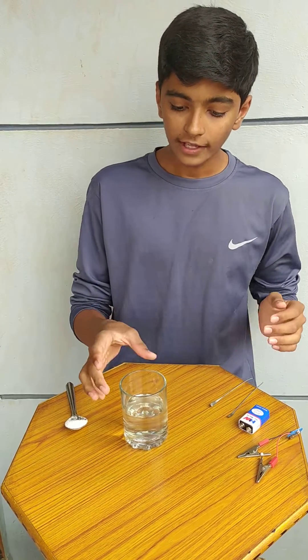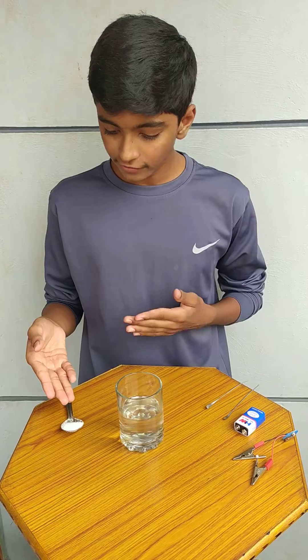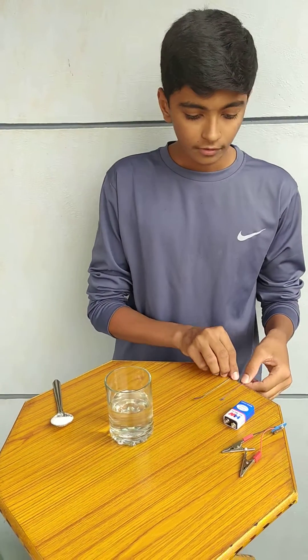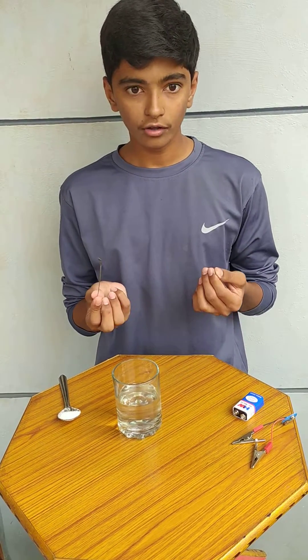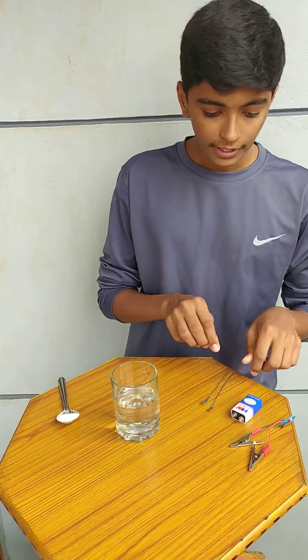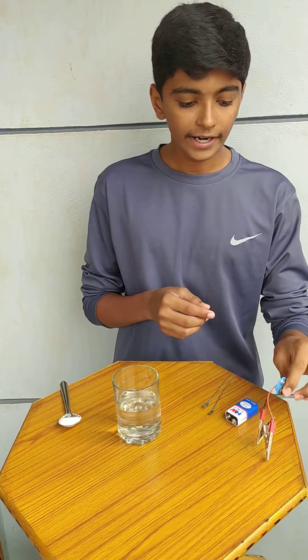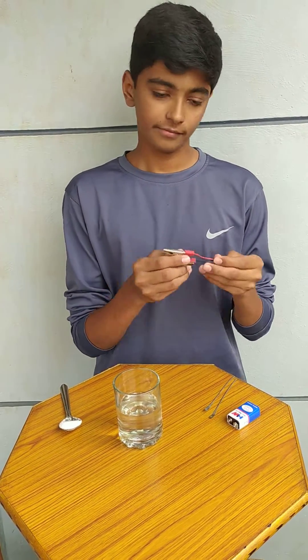For this experiment, we need a glass beaker, H₂O or water, NaCl or common salt, two metal conductors, one battery and an adapter and holders.